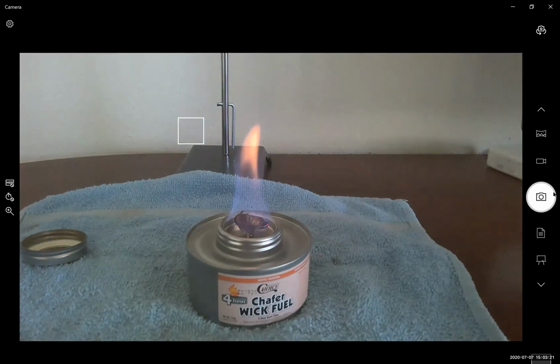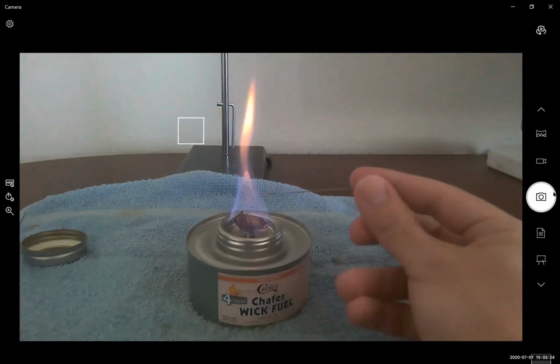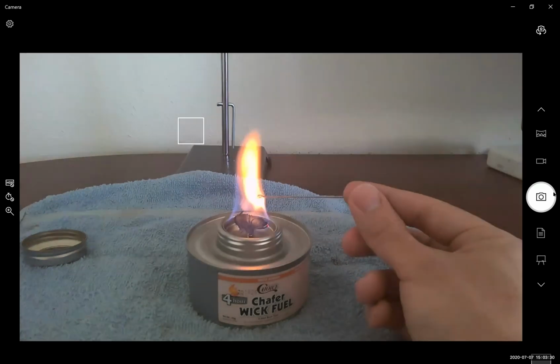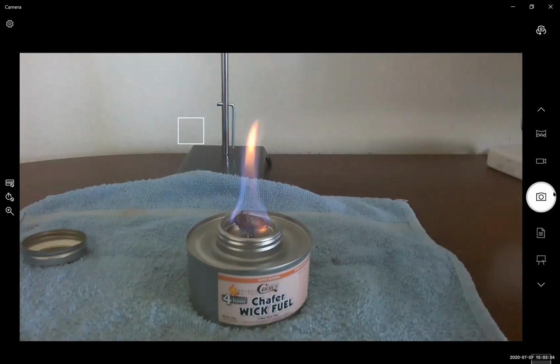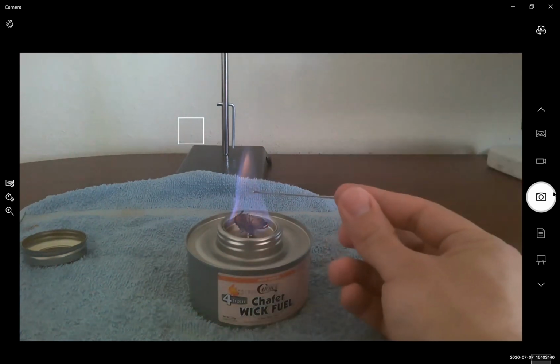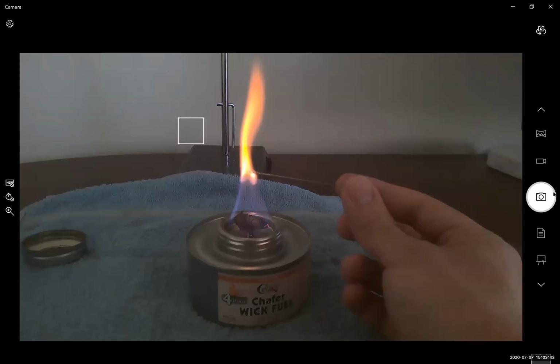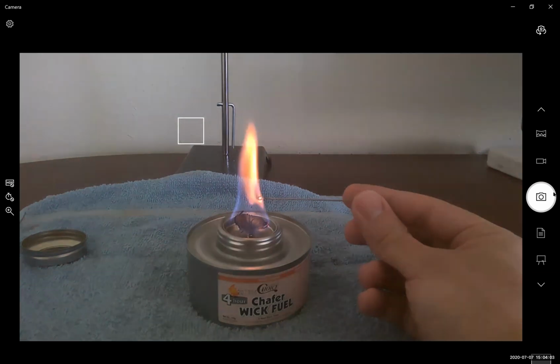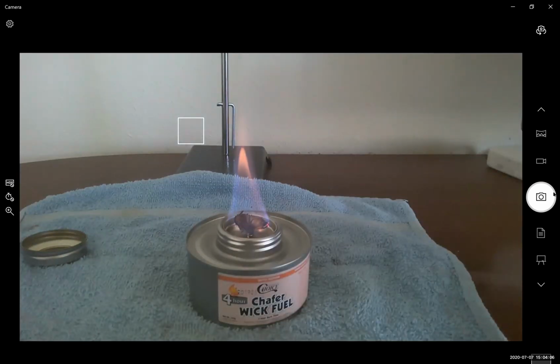I'll view it from the camera perspective to see if you can see it. Does everyone see that pink purple color? That pink purple overtone? What does everyone think when you're testing your samples using your own flame? If you bring it from the side, does everyone notice how that orange color has a bit of pink and purple to it?